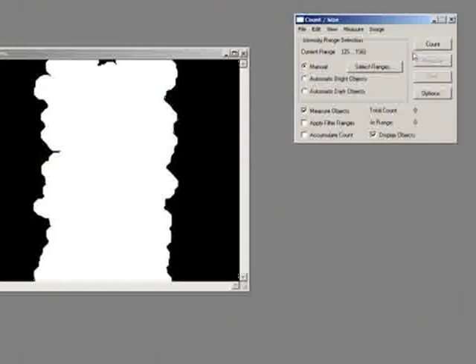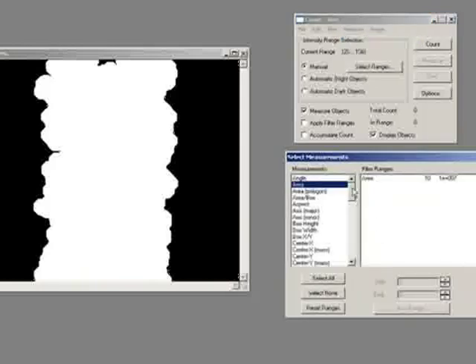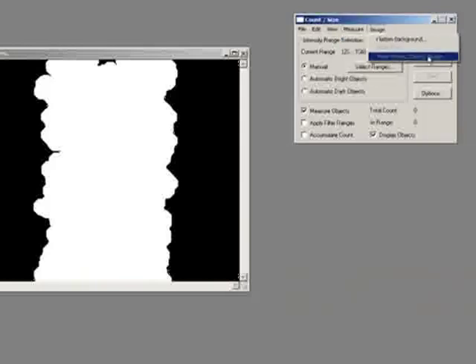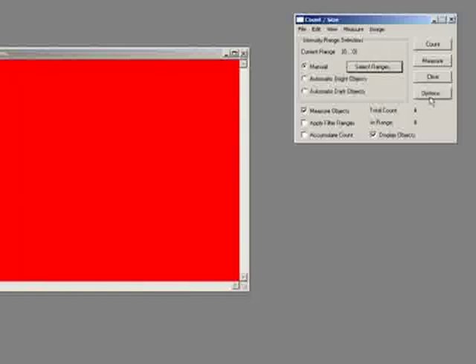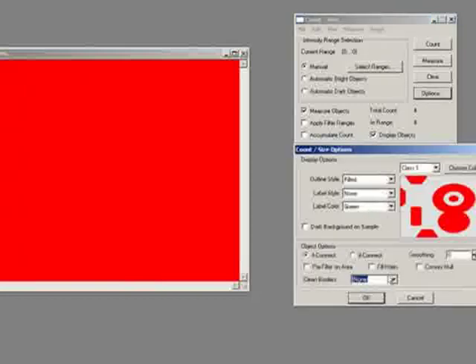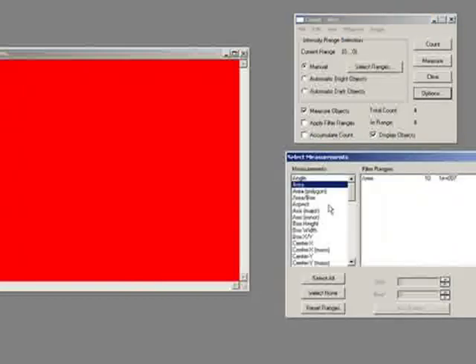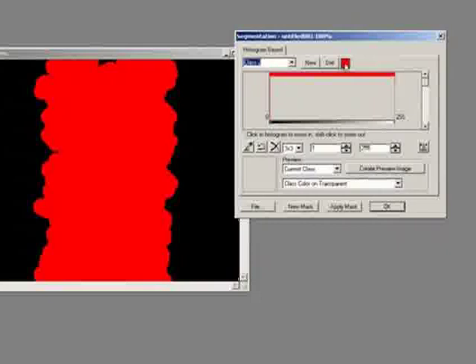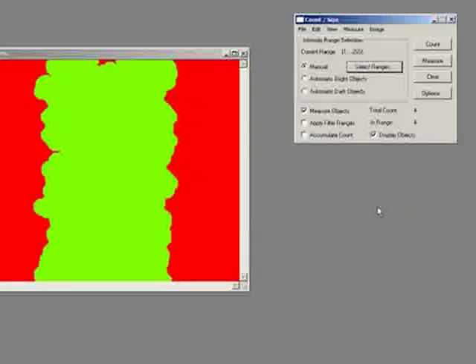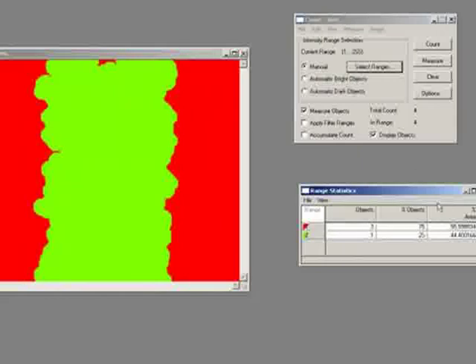Or alternatively, I could just do a count. So measure, select measurements, and I could just do, actually, no, I don't want to do that. I want to just do a range 1, range 2, count without fill holes on, count. Ooh, nice. So what have I got here? I need to change the color of the second one. There we are. Cool. View, range statistics. So 55% wound, so on. So we could monitor the percentage gain over time. Even I have to remember how to do these things sometimes.